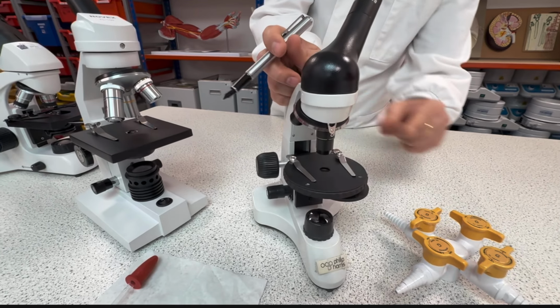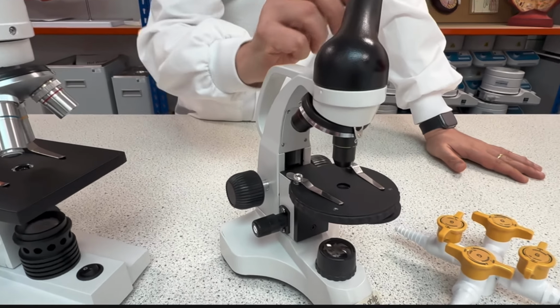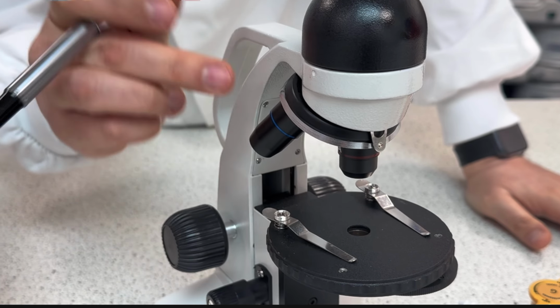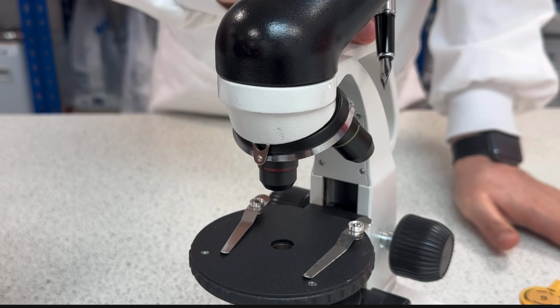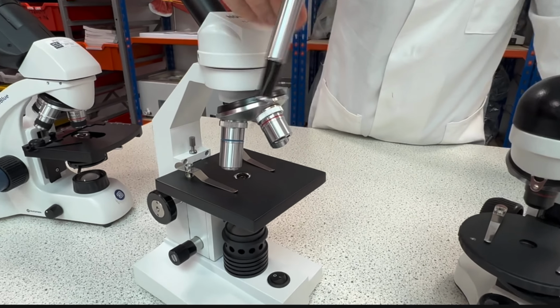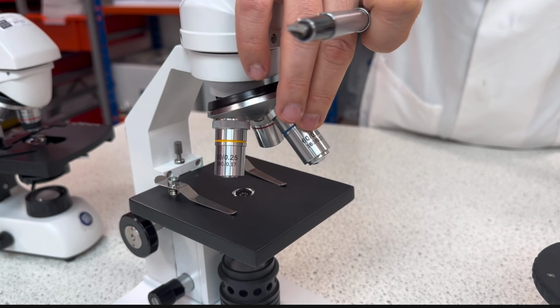As you can see, in this microscope we have 3 objectives with different color codes. One is red, this one here, the other one here is blue, and the last one here is gray but supposed to be white. In the second microscope, I also have red, yellow, and blue.